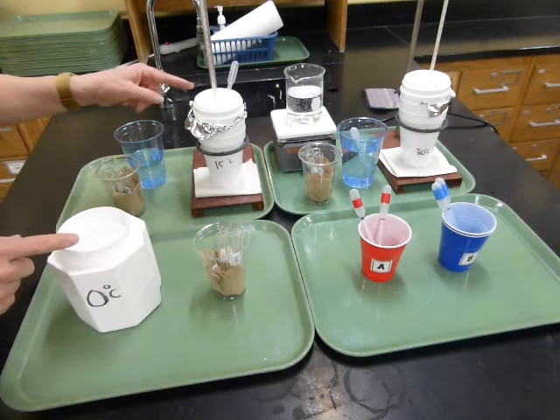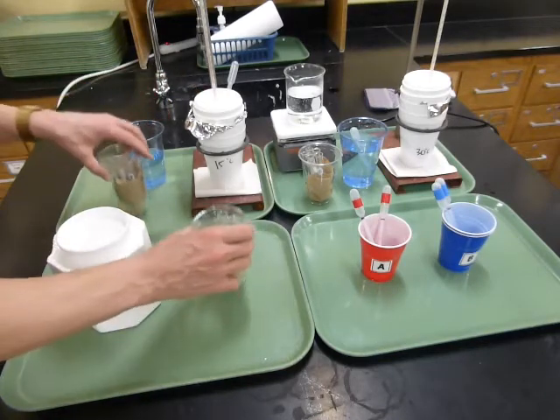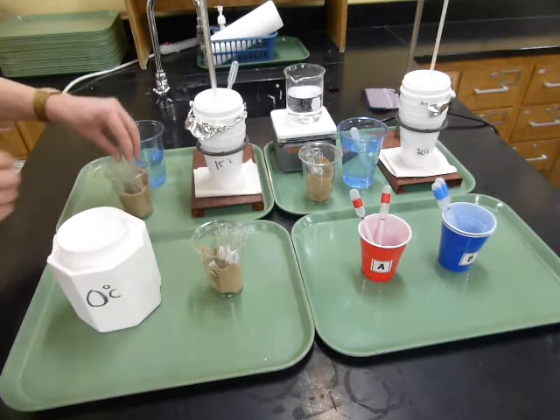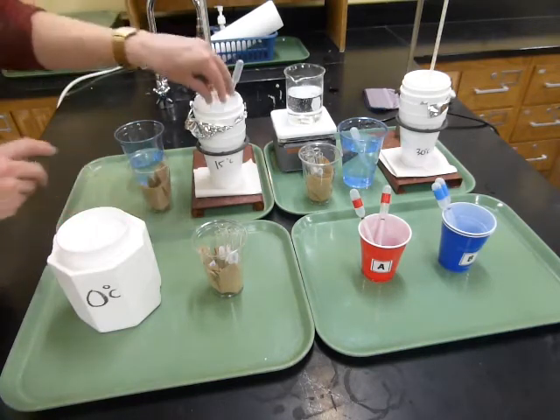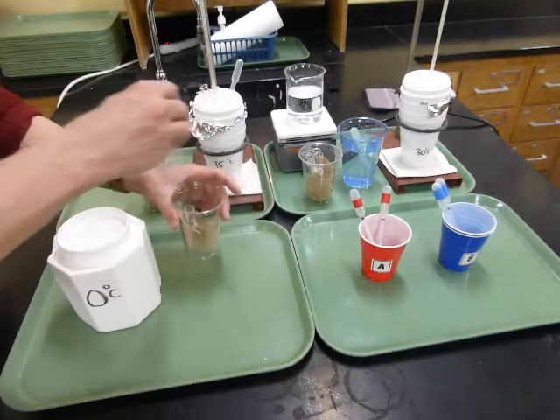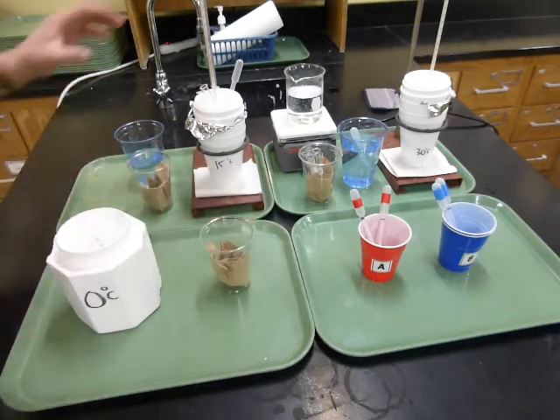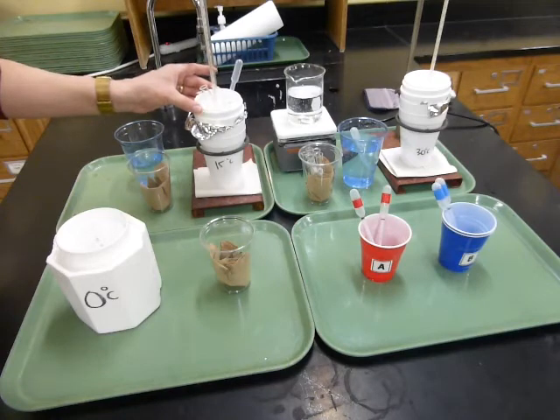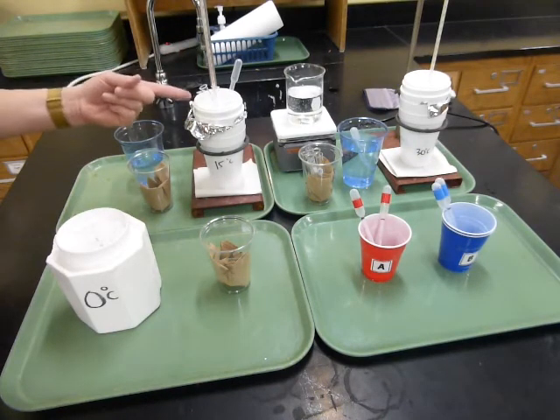Once you've got the temperatures in these to the correct level, then you can take the test tubes and you can put them into the water bath. That means don't pour them into the water bath. That means put them into the water bath so that they get to be the temperature of that water bath. So all the ones going into the 0 degree ice water will go into that cup. All the ones that are the 15 degree cool water will go into that cup right there. And we'll leave them in there for about 3 to 5 minutes until they get to the temperature of that water bath.